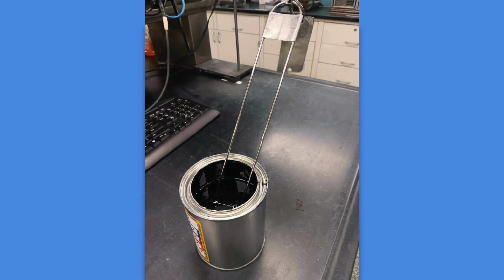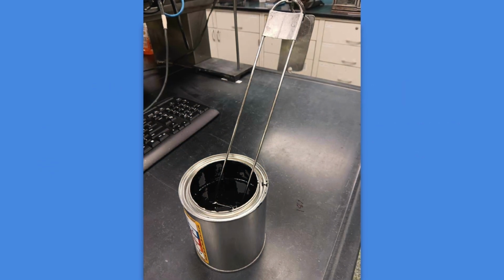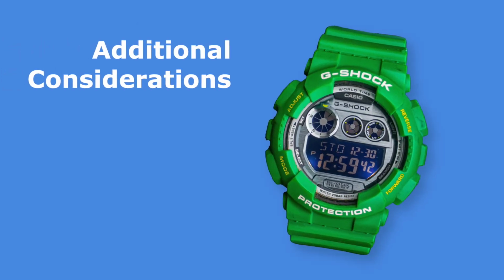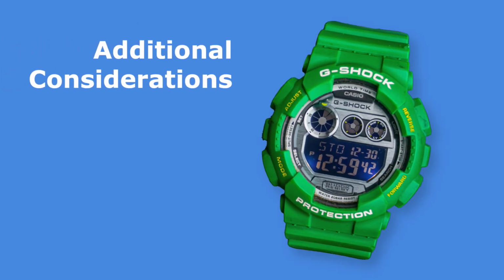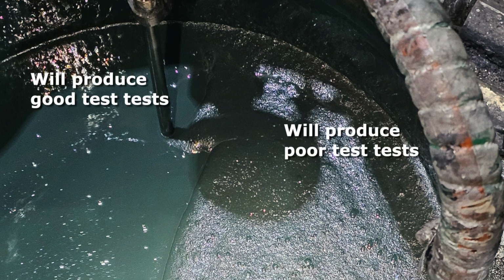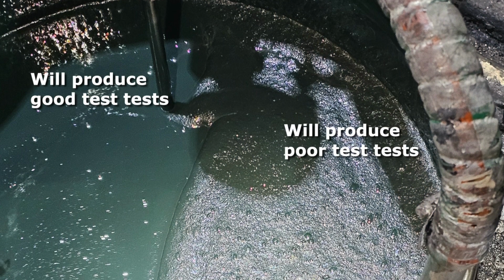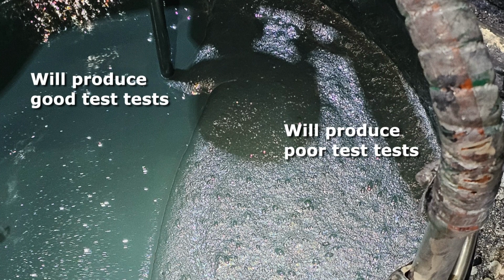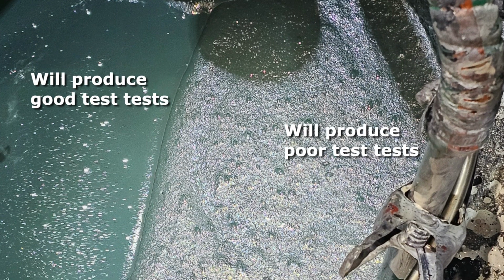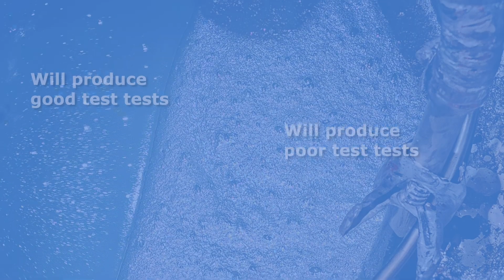This is accomplished easily enough by allowing the cup to remain immersed in the paint for at least 10 seconds. Additional considerations. Be sure to use a timing device where the readings can be taken with a resolution of 0.1 second or better. The paint to be tested should be visibly homogeneous and free from any foreign material or air bubbles. A small number of bubbles are acceptable, but paint with considerable entrapped foam will produce an unreliable reading.